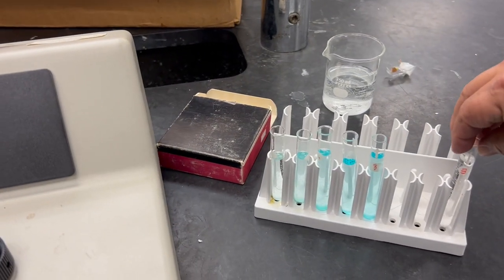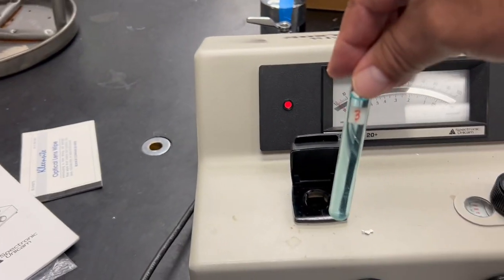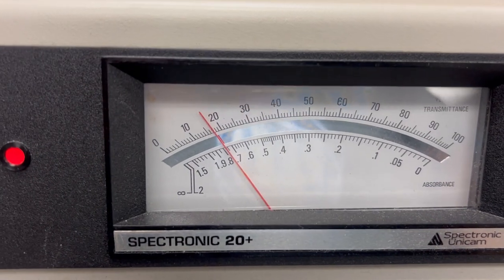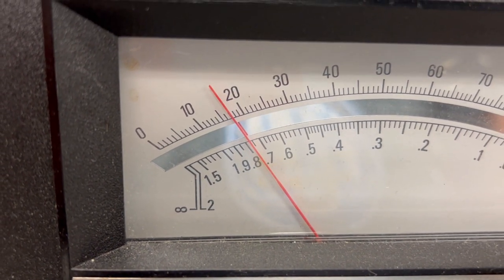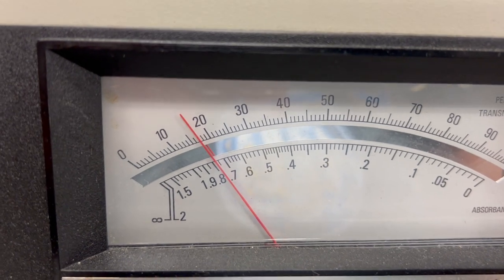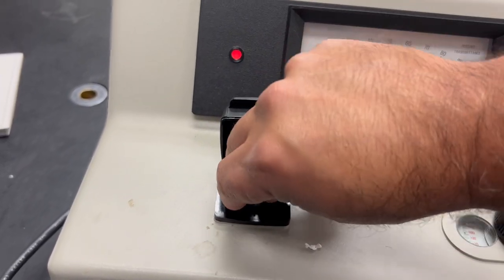Now get one of your samples. Clean it with a lens wipe, point it so the frosting faces toward you, and put it inside the machine. Close it and read the percent transmittance — this one looks to be about 17. The absorbance scale reads about 0.78, but it's hard to read, which is why we use percent transmittance. There's a formula we'll use to convert it to absorbance.